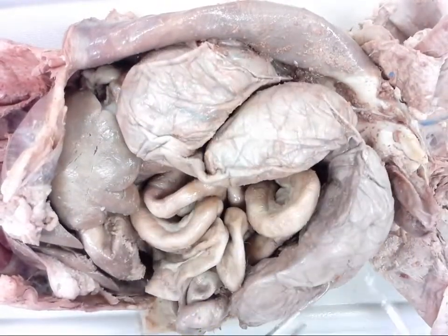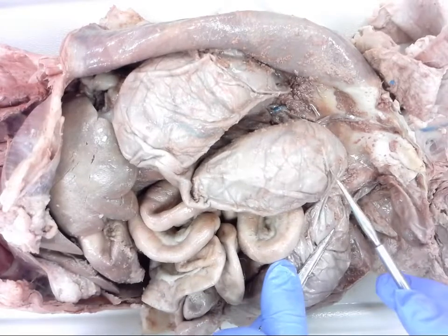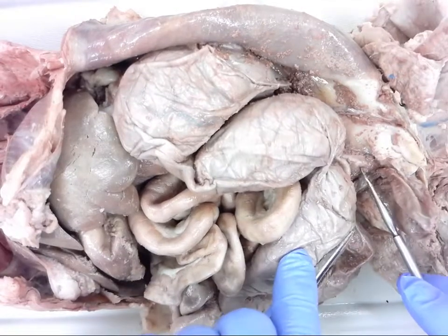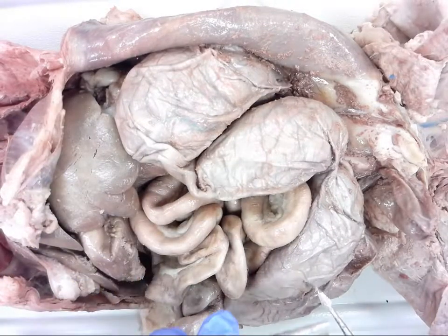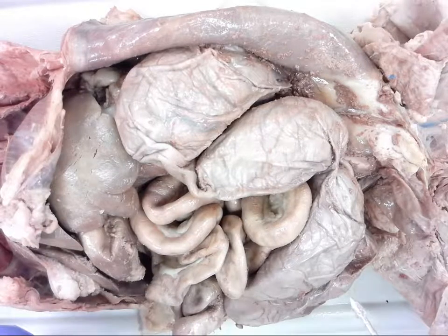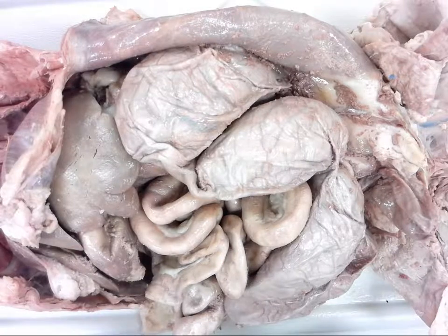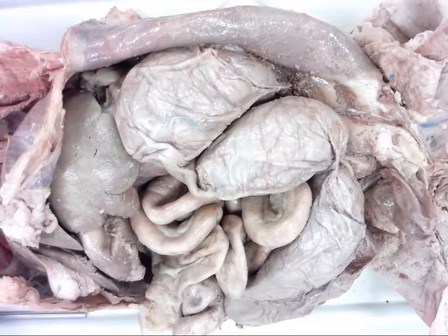It looks almost as big as what the inferior vena cava would be size-wise, but it's actually going to feed back into the inferior vena cava right here on the bottom. It's a very large vessel and we're getting a lot more blood flow because there's a lot of development that needs to occur, especially when having five babies. Looking a little bit lower, you can see where the left uterine horn and the right uterine horn come together right here, and you can actually see the uterus right here. This specimen is being dissected by a group of students who are very interested in doing this part of the dissection on their own.